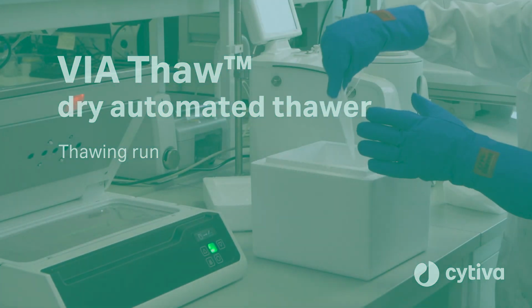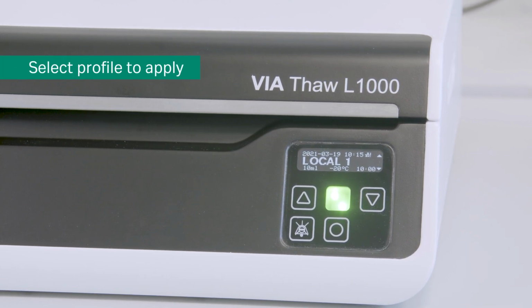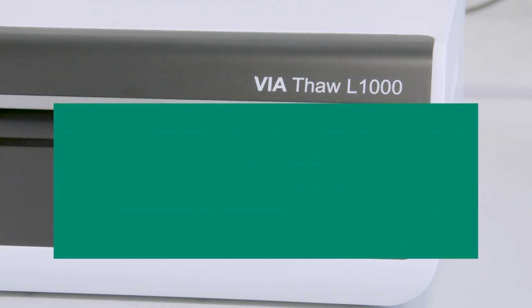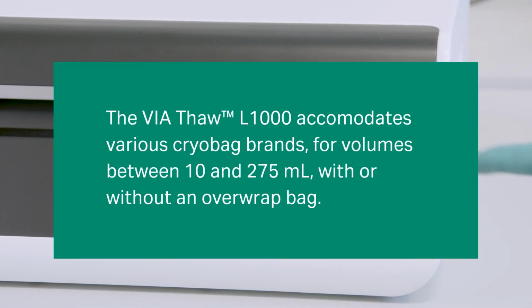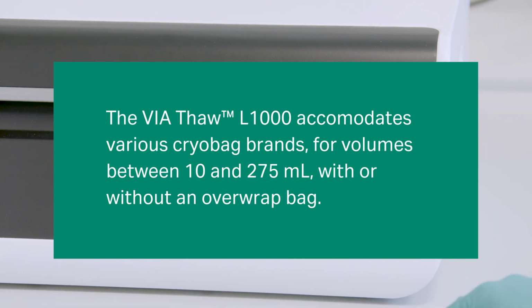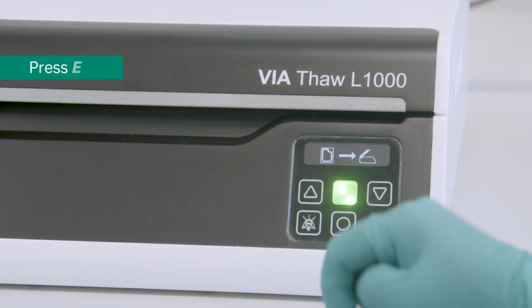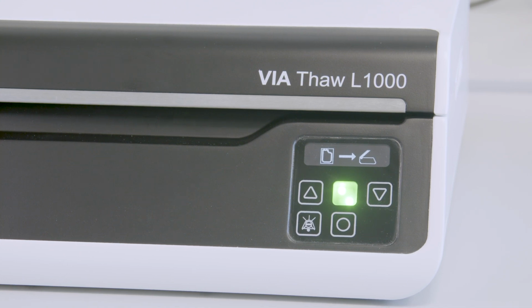To perform a thawing process, first use the control panel interface to select the profile you want to apply. The Thaw L1000 instrument accommodates various cryobag brands for volumes between 10 and 275 milliliters, with or without an overwrap bag. Once you select the desired profile, press the Enter button. You can see that the system is now ready to load.